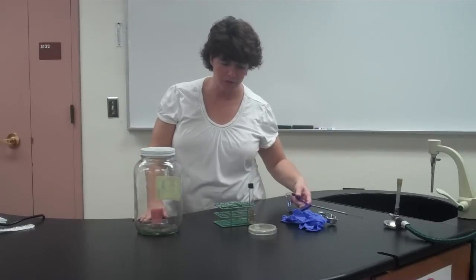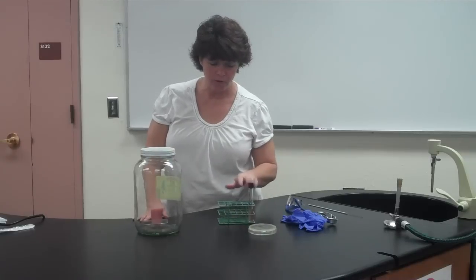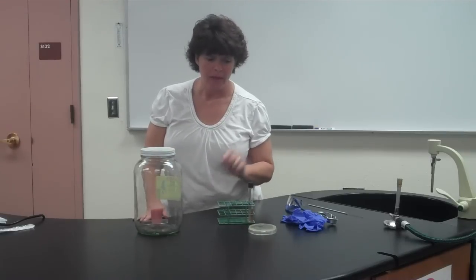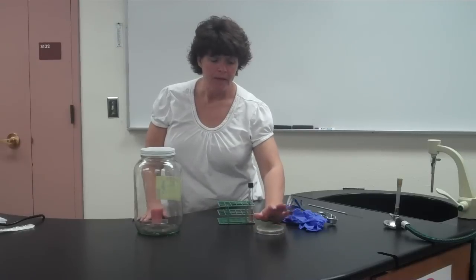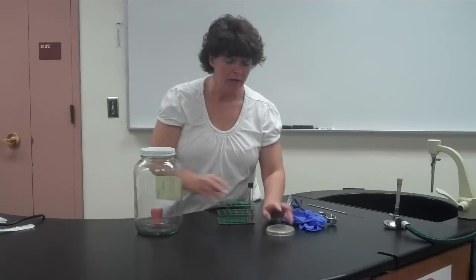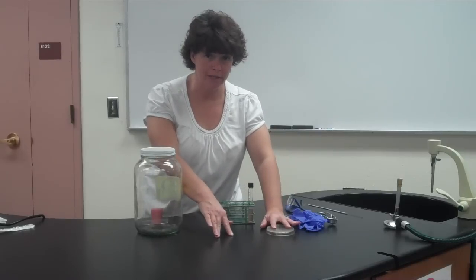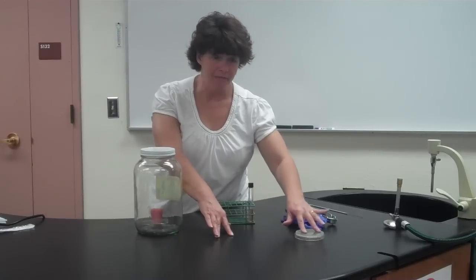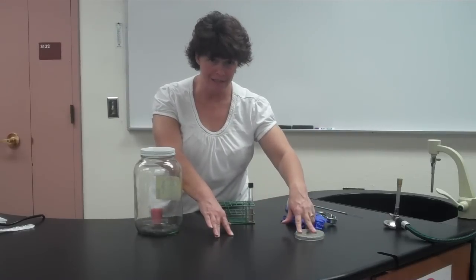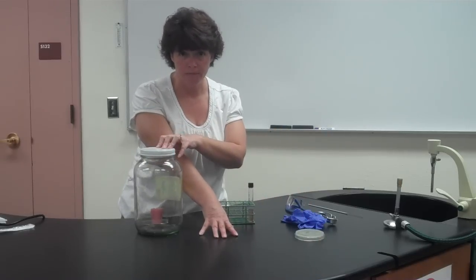You're going to use your sterile technique, gloves, and goggles. You will take your four bacteria and use four thioglycolate tubes — one for each bacteria. You'll also have four plates. Two plates will be grown aerobically and two will be grown anaerobically. Divide each plate in half and put two bacteria on each plate, one on each side. The aerobic plates go in the incubator as usual, and the anaerobic plates go in the candle jar.